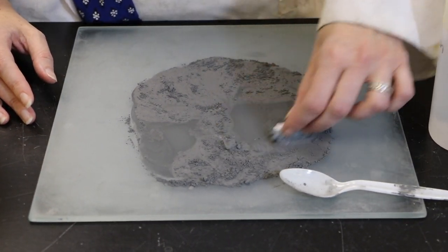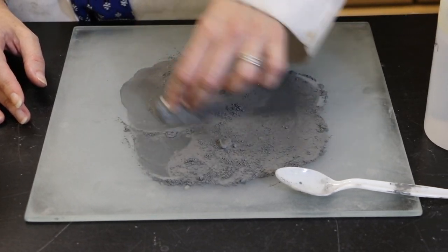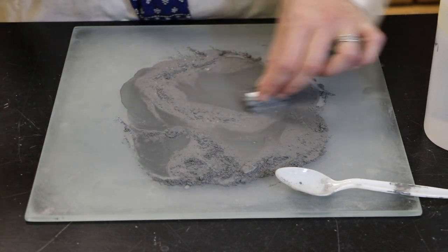You don't need to push down very hard. You want the motion to go sideways, and you want to go back and forth over the grit. This can continue for a long period of time.